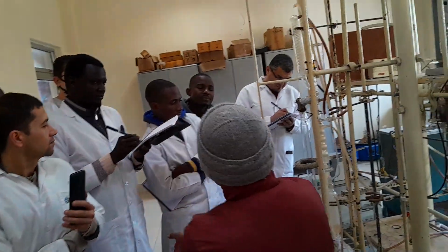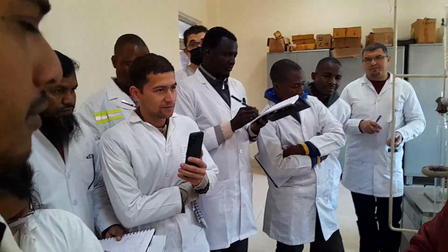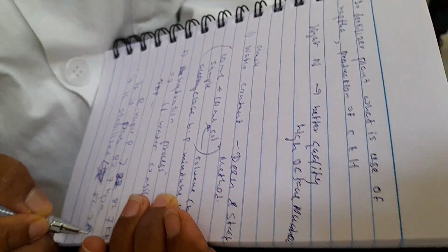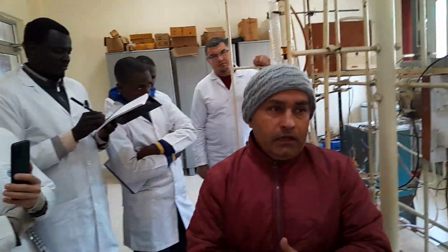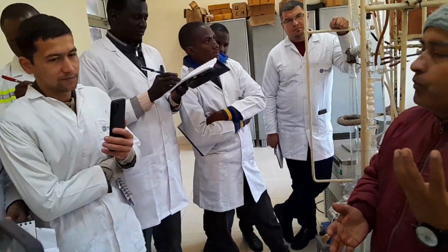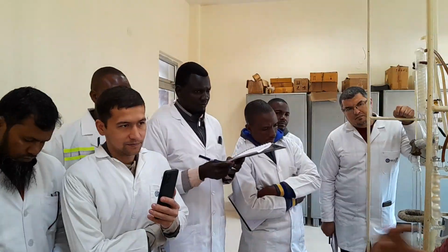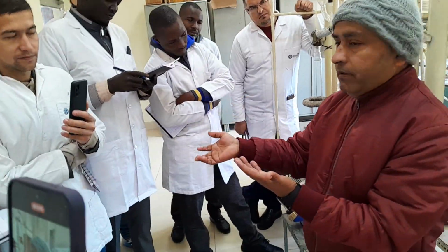Obviously, the second question is: what is the reason it should not be more than 82.7 kilopascal? See, dear, when you are doing the fractional distillation, after completion of the distillation you will have to take the material balance. Initially, I have taken a 100 ml sample.